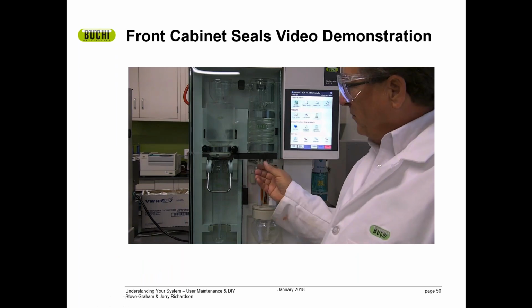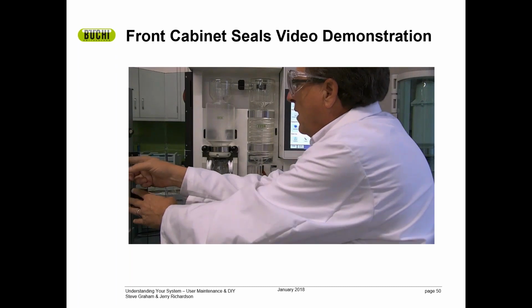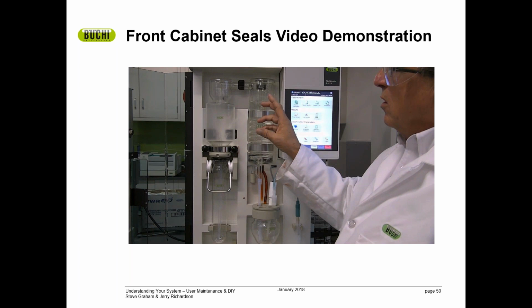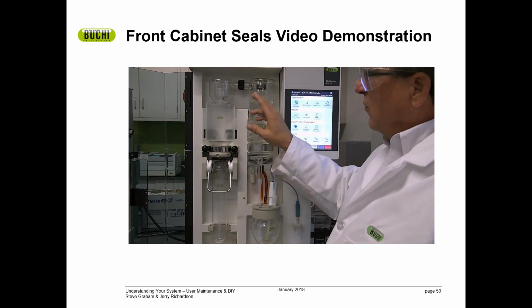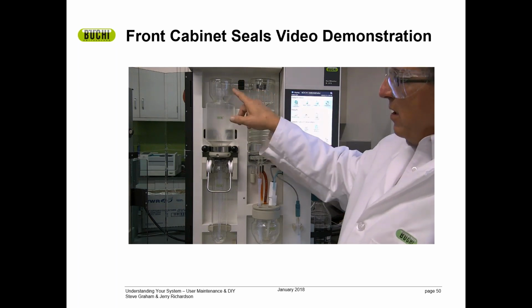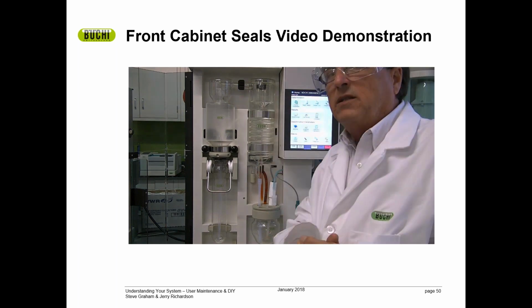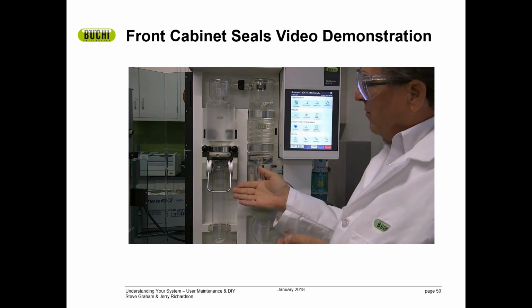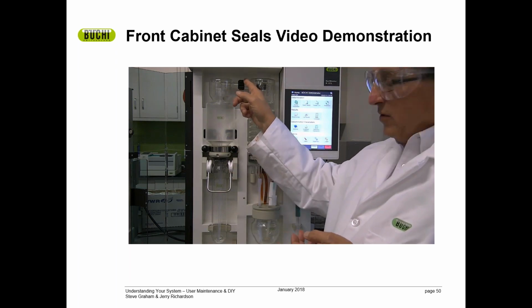Of the cabinet, we have our safety shields that we're going to open. That gives us access to two very important parts and two very important seals on the instrument. The first is up here. This is the seal between the condenser and the splash guard. This is probably the most likely reason why your nitrogen levels could be low. When the ammonia is evolved, it goes up here and leaks right out of here.